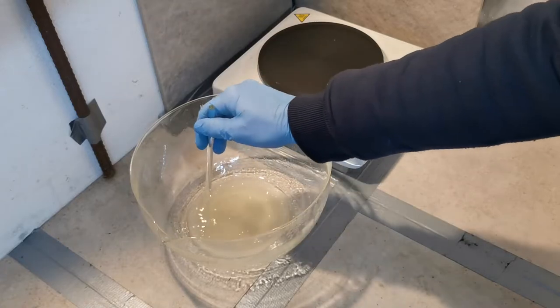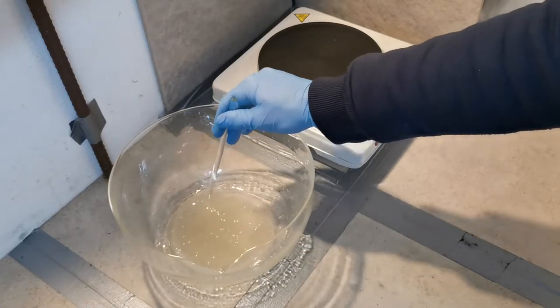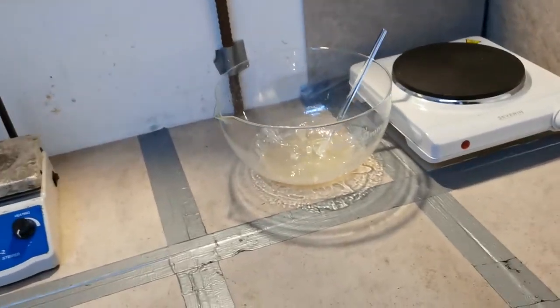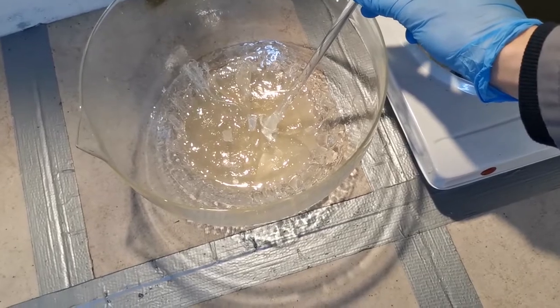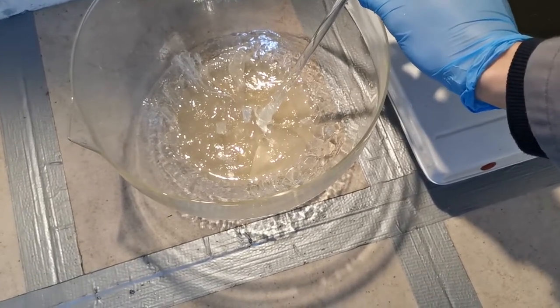Once I came back an hour later it had all solidified into one huge chunk. This was a pain to get out of the glass evaporating dish. In hindsight I should have used a metal pan where I could just smack the back with a hammer to get it all out.